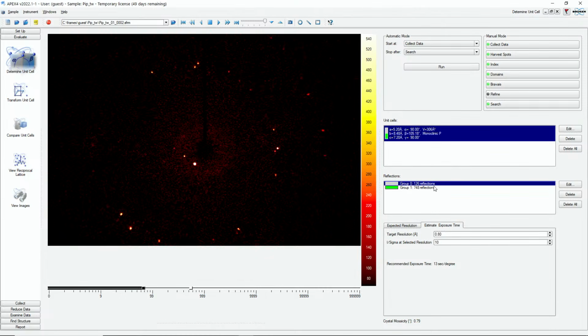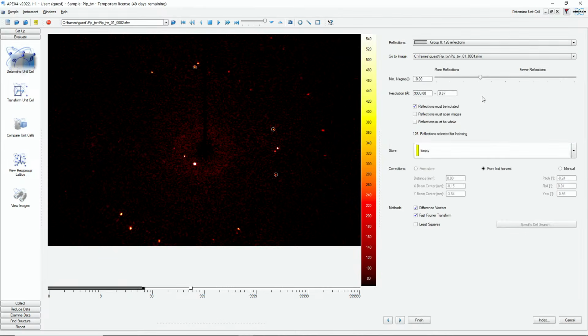So this is one method how we can index. We're running out of time a little. There are other methods, also more automated methods. I will just show one where we can do this. There is a method here, a least squares method.